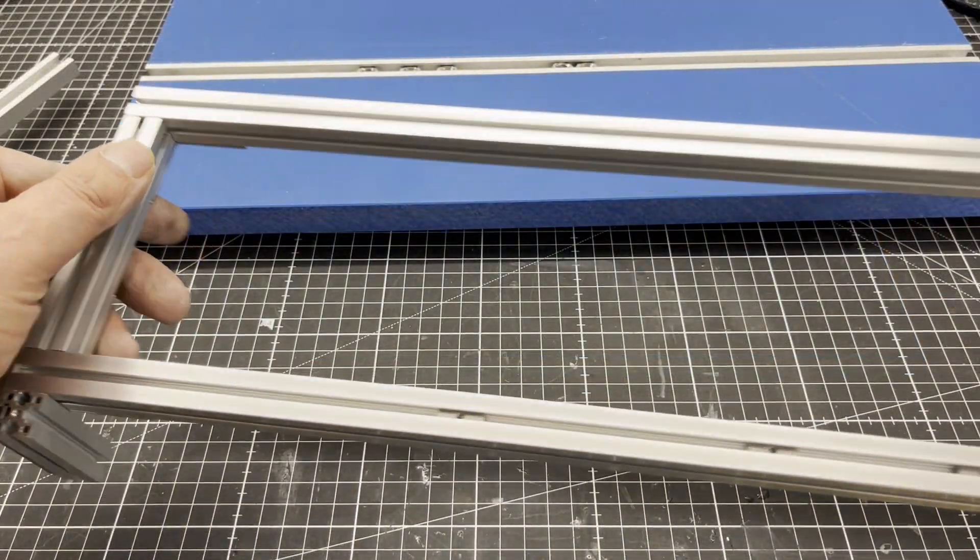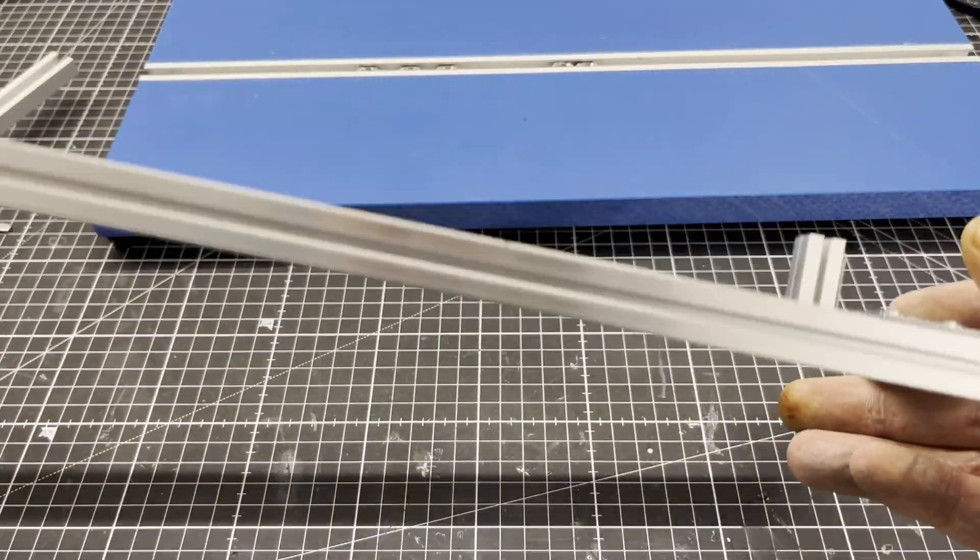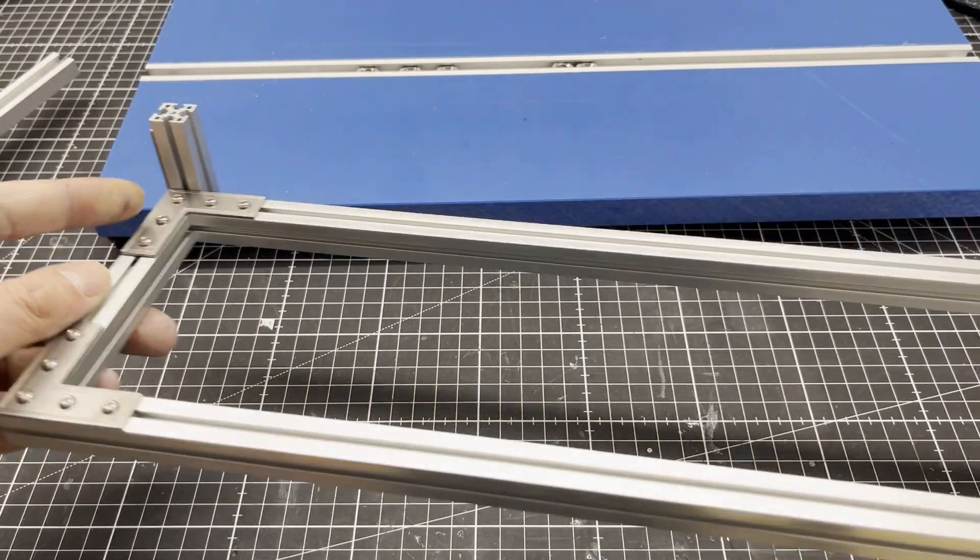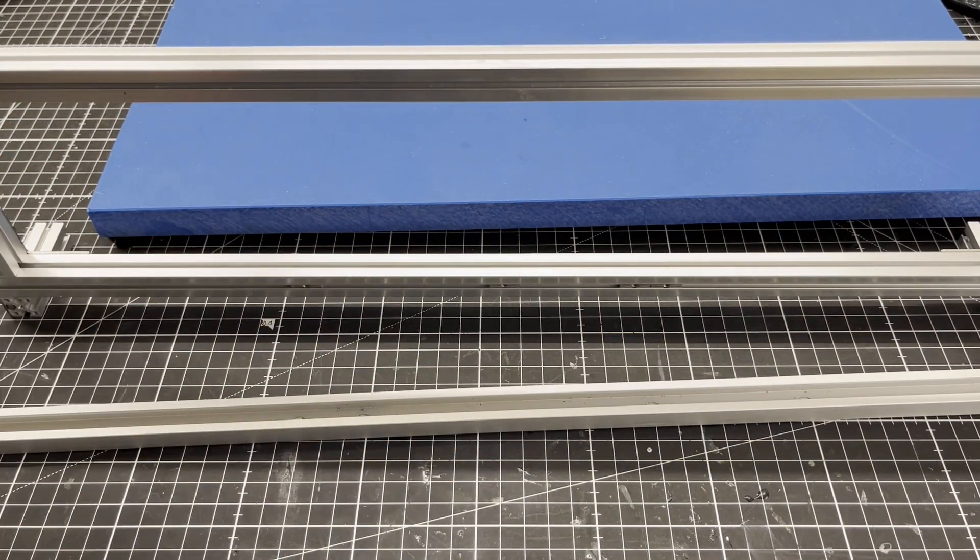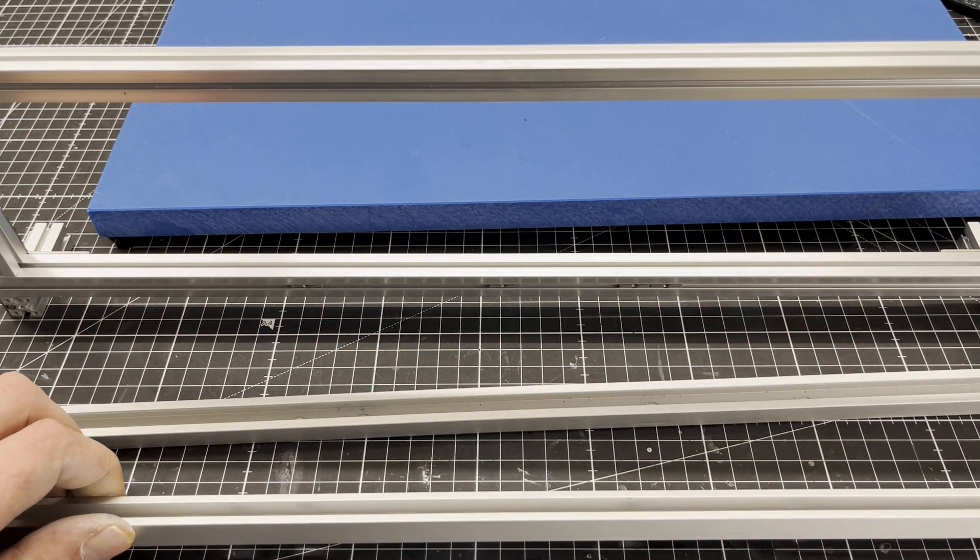A frame for the vertical construction of the apparatus was then screwed together from aluminum mounting profiles. Once again, C-profiles were used as the fastening elements.